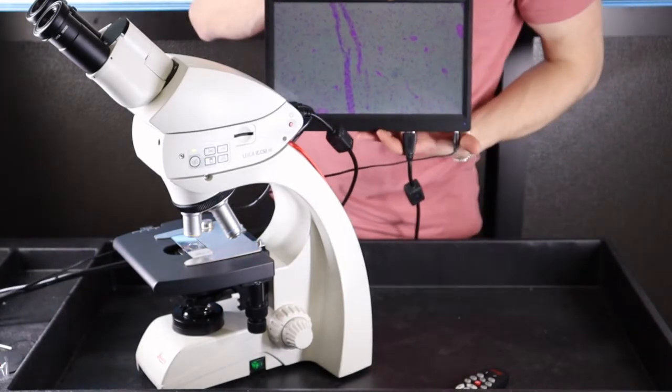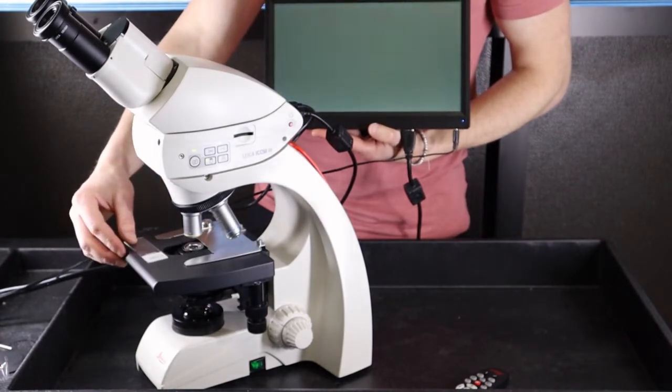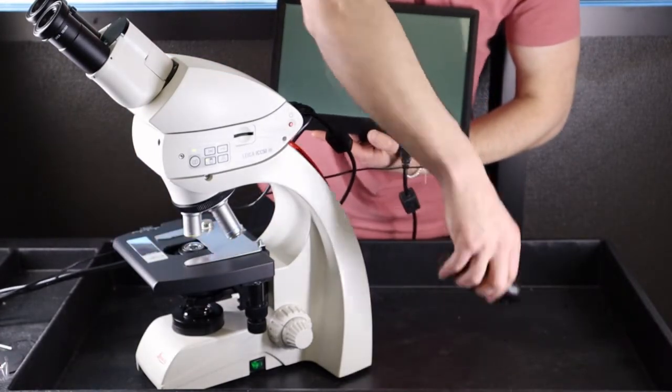If you start the camera and the coloring does not match, you can do a white balance. Remove the slide from the microscope and take the remote.